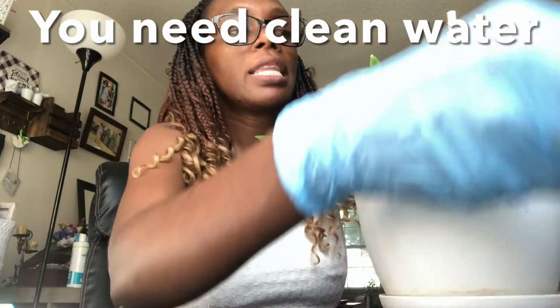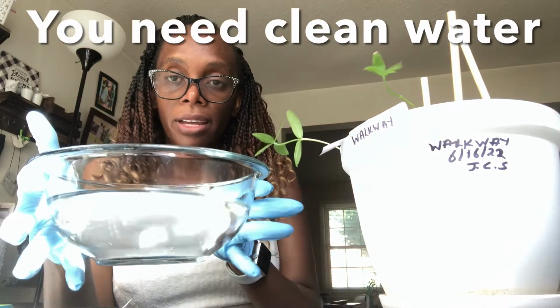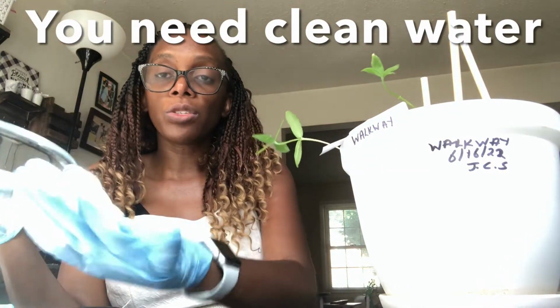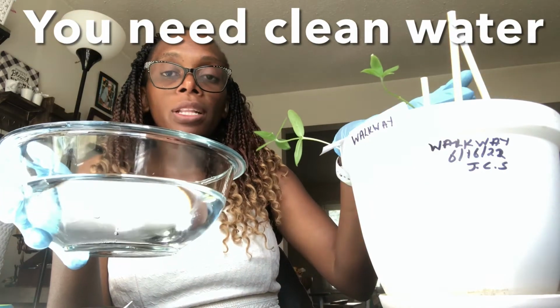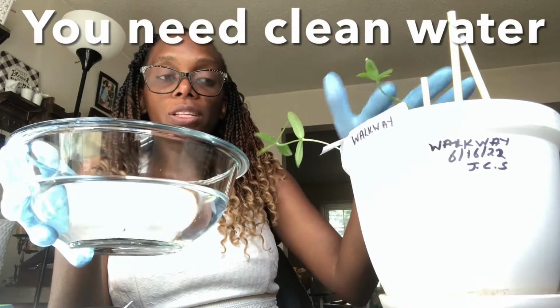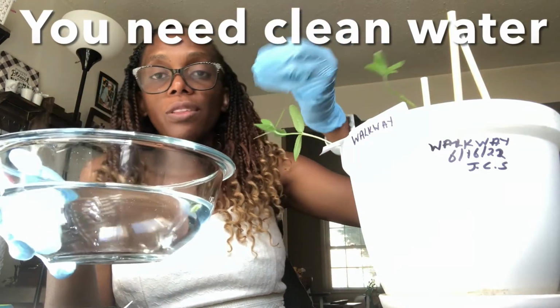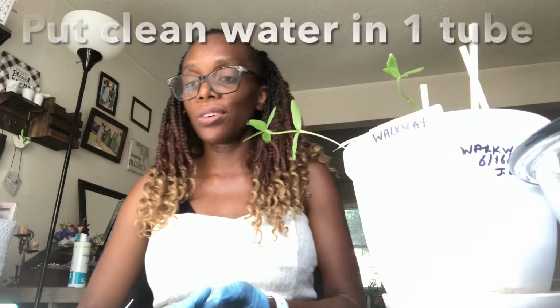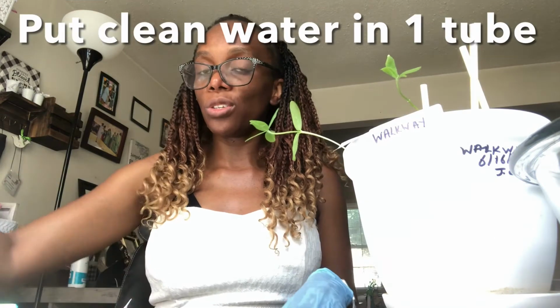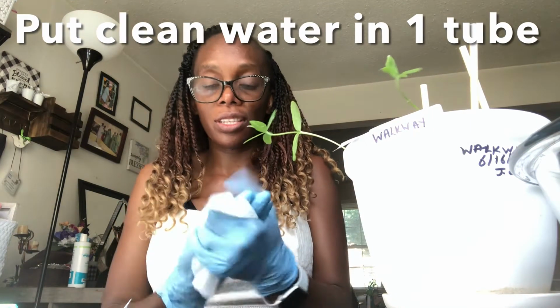And then one thing that I forgot is that we need clean water. Clean water that we're going to use to make our dilutions, and then later put in the pot to help soften the soil so we can actually dig up our plant, and then rinse off the soil particles. All right, so let's fill our 3 tubes with the necessary solutions, the ones I need.